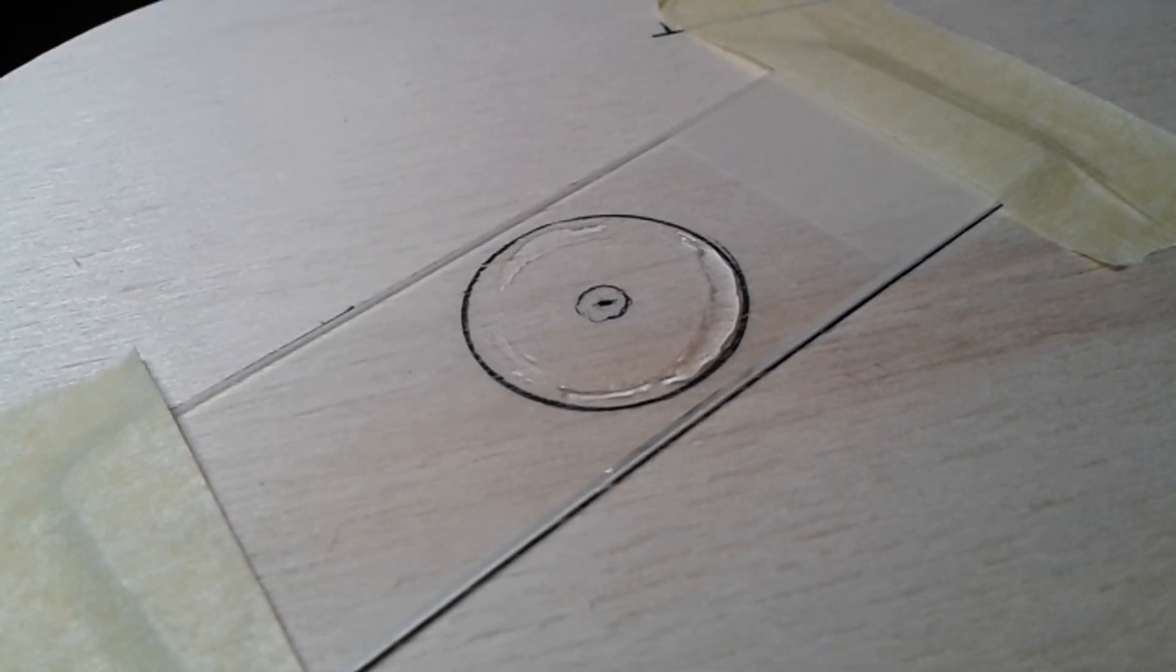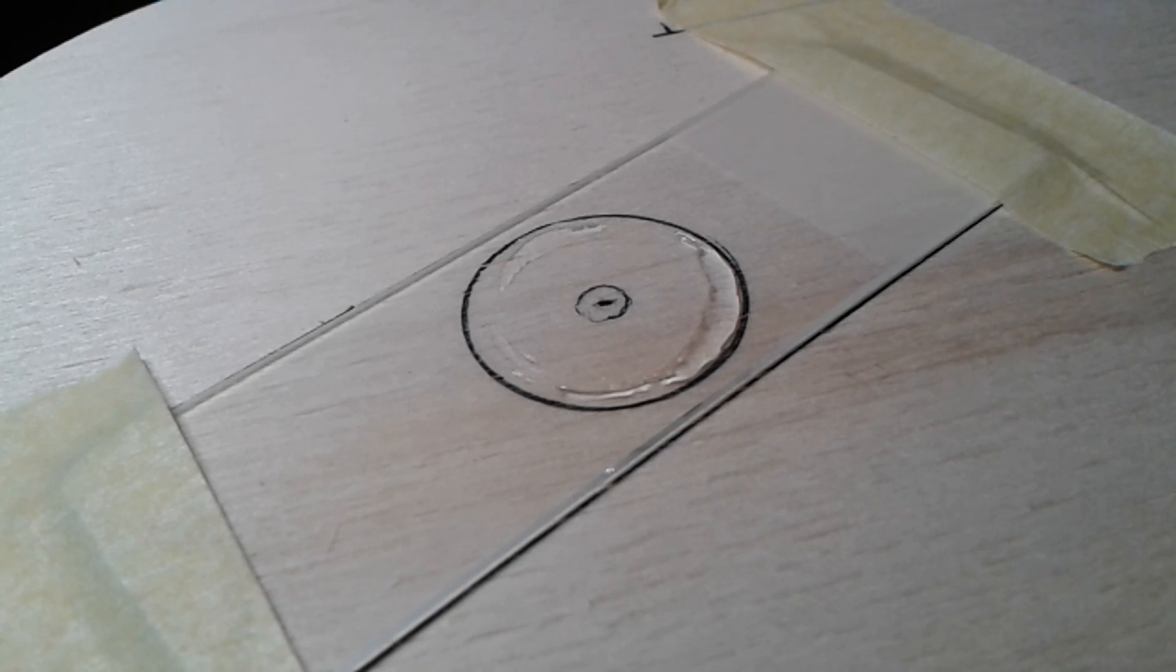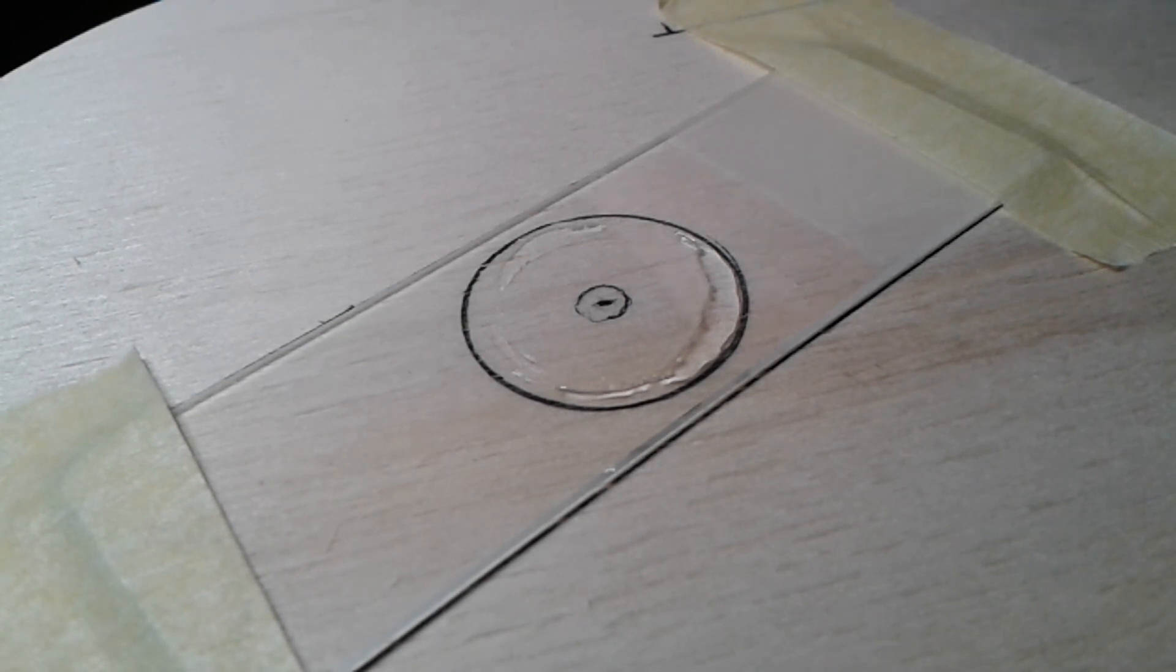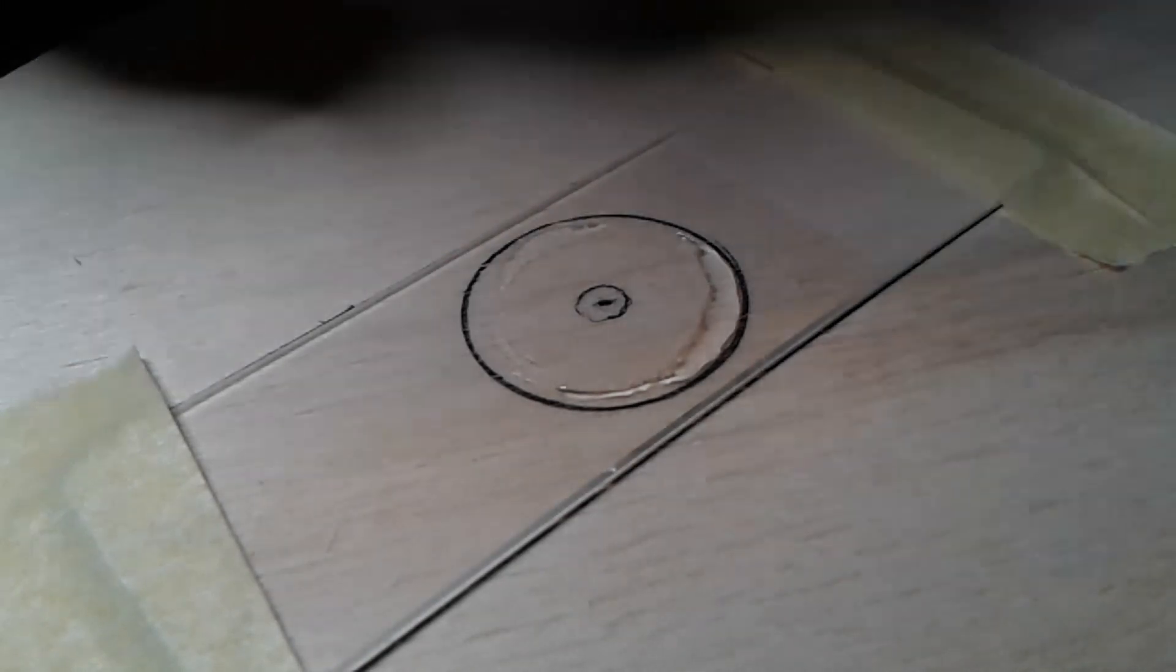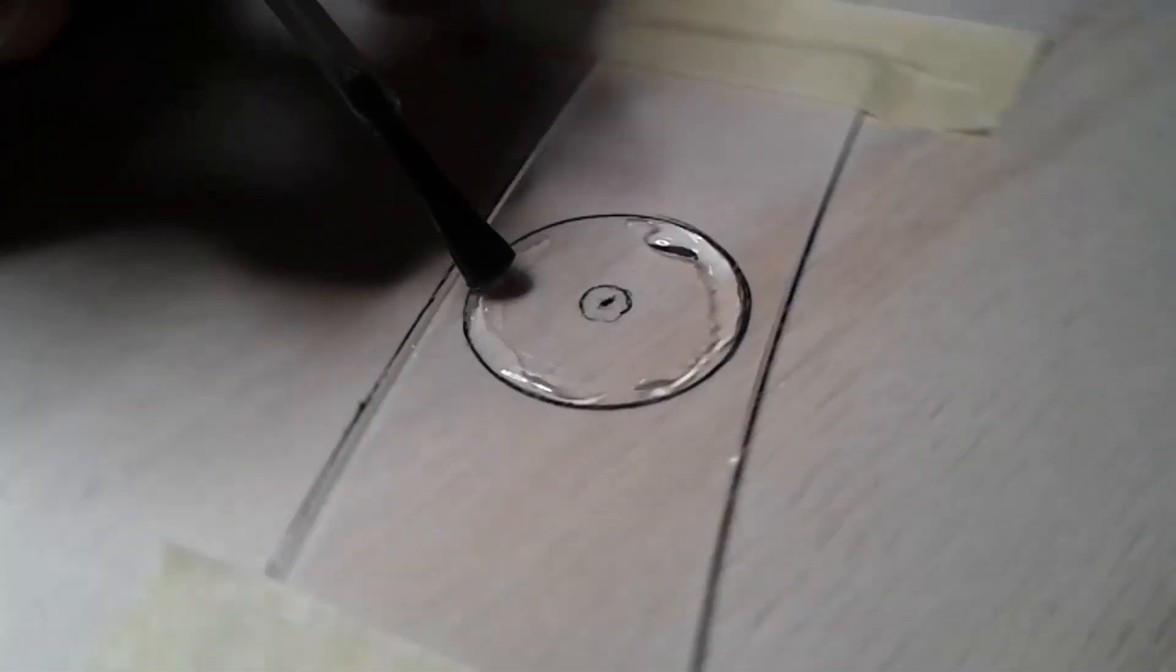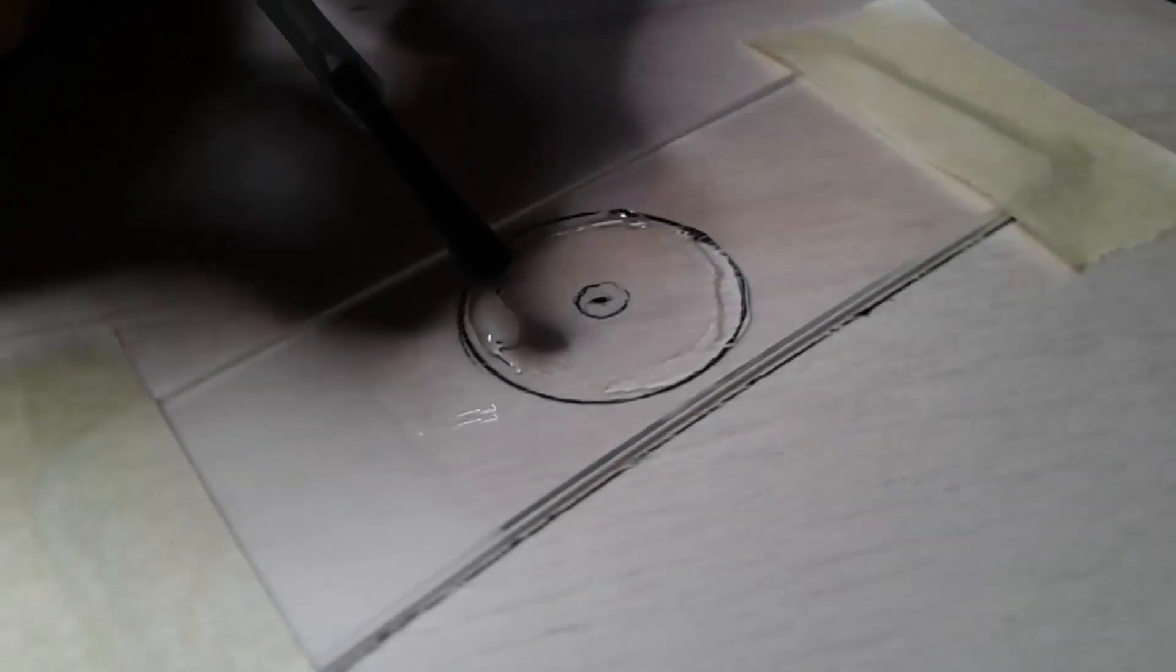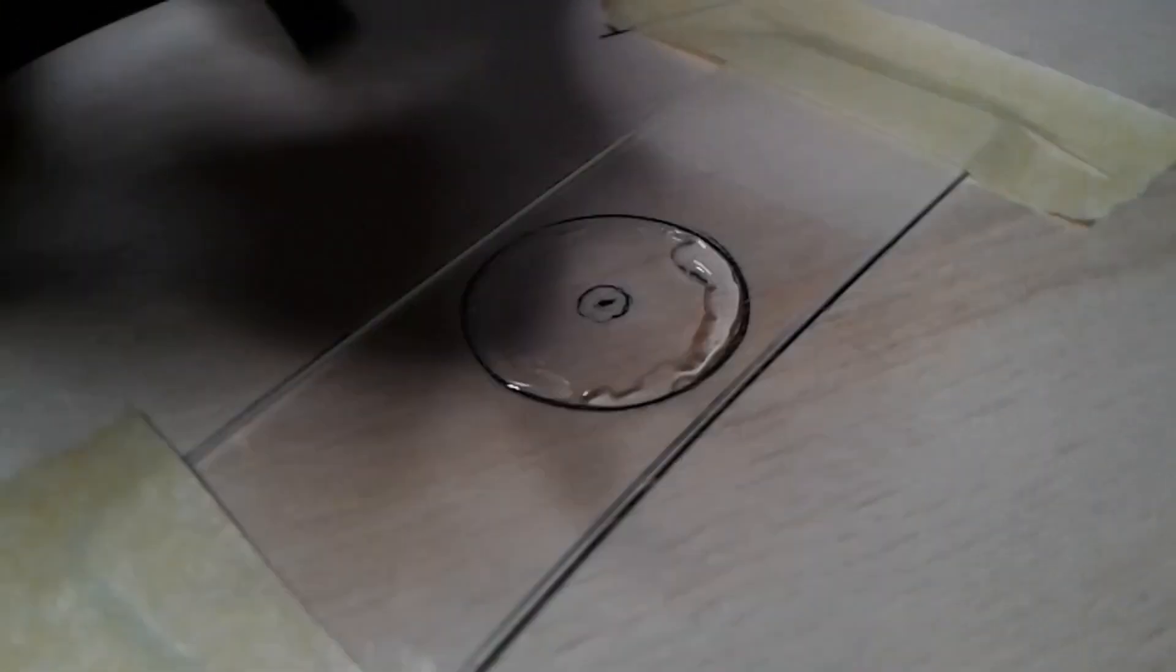I'm going to try it again with the much thinner nail polish. I think also the brush is a little bit of a problem because it's relatively thick.